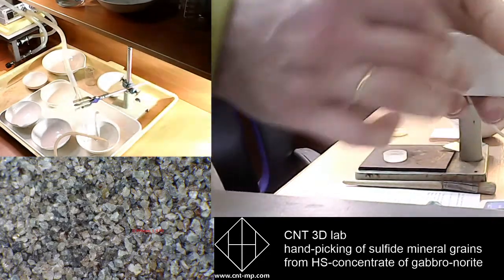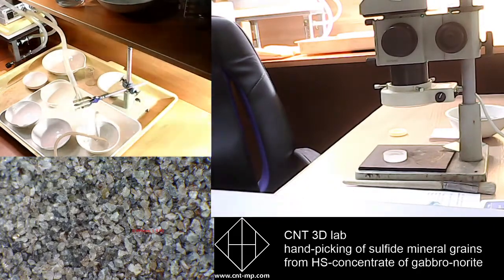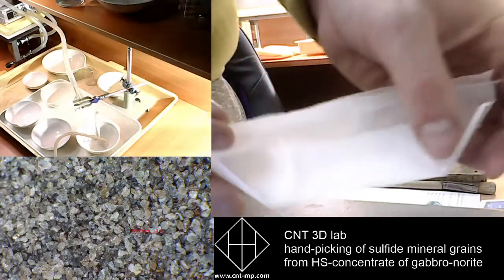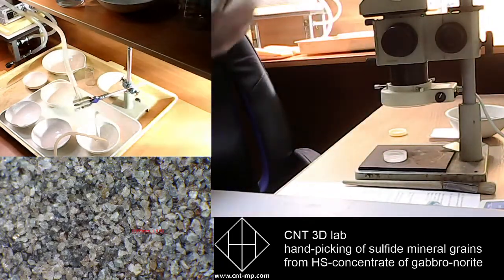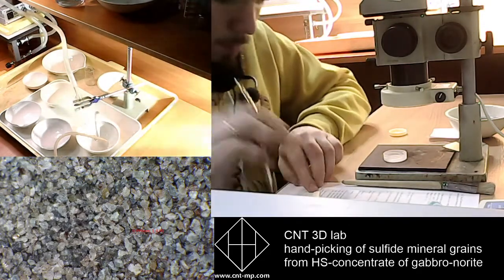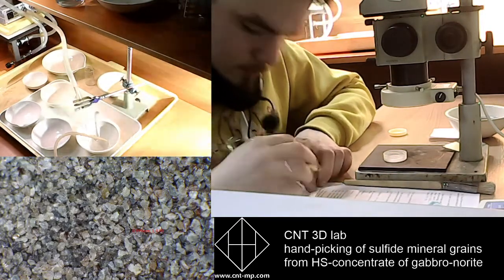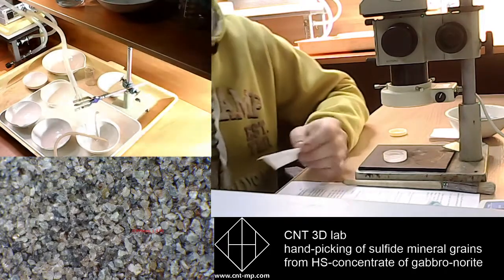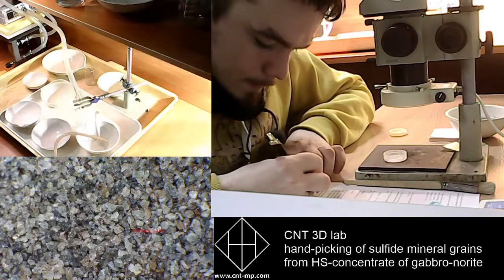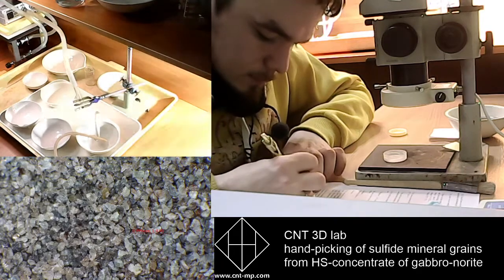Oh, sorry, this is a thin paper, water resistant paper, which we sign by our pencil or pen. This is pencil or pen, and this is ash sulfide sample 2.